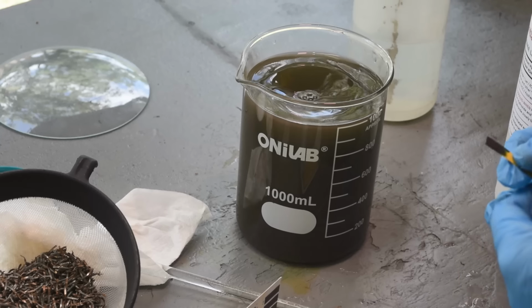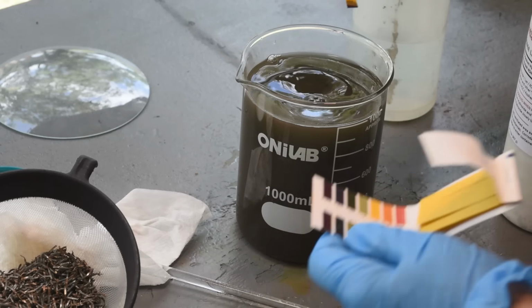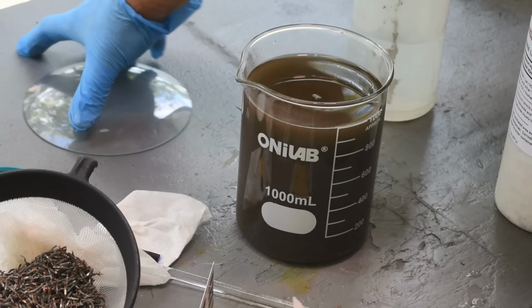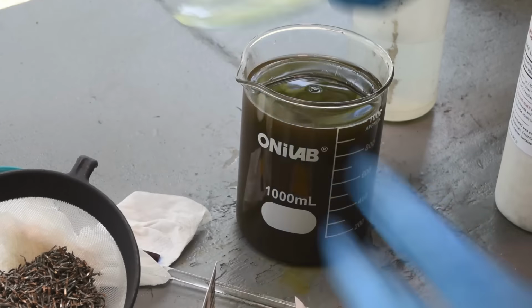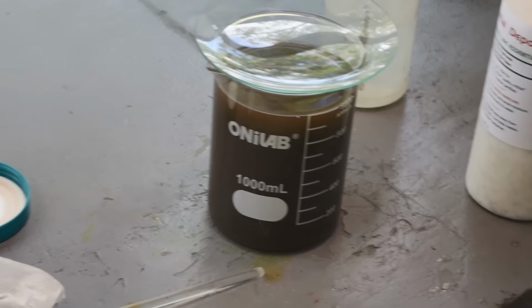Let's see where we are here now. That might be thunder. What's going on here? Okay, I'd say that's 12. All right. So we're just going to let this sit and let all of the hydroxides in there settle out. And then we will go on to try and capture the gold that should be in there, along with all those metal hydroxides.